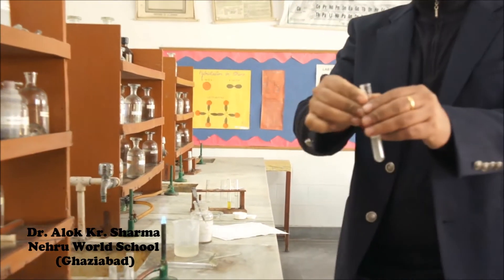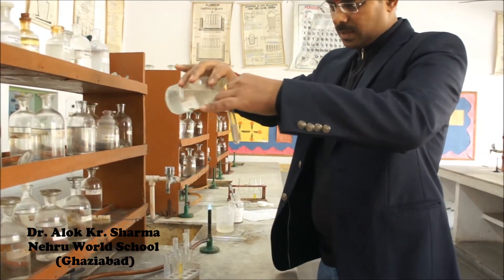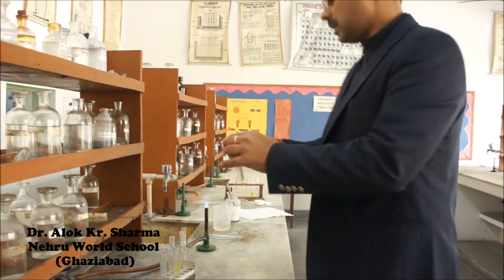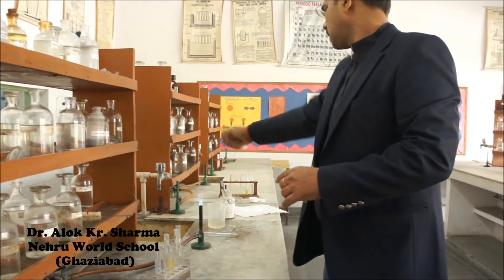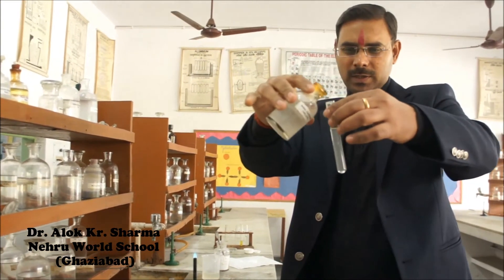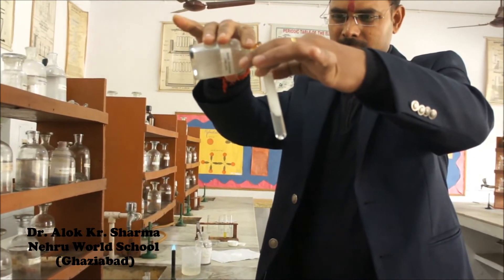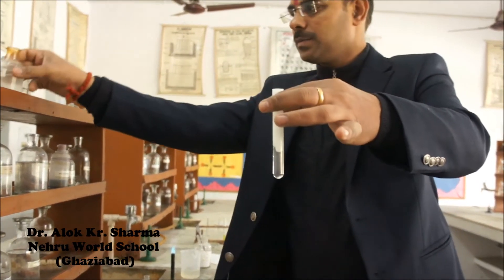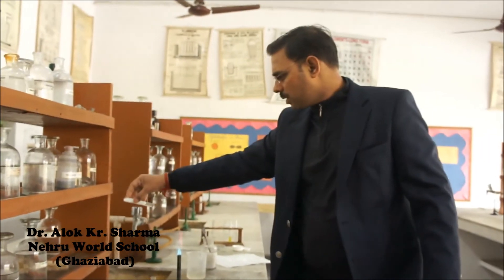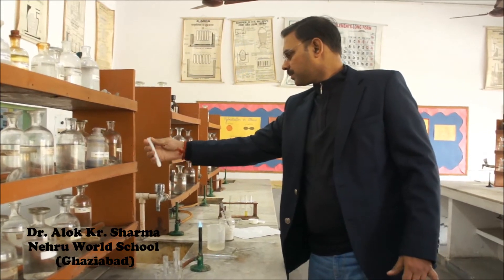And then NH4OH in excess. And ammonium carbonate. We see a white precipitate forms with ammonium carbonate.